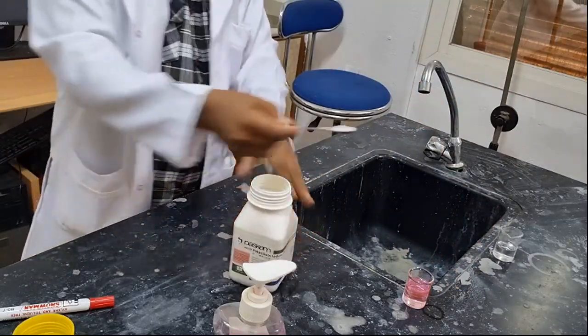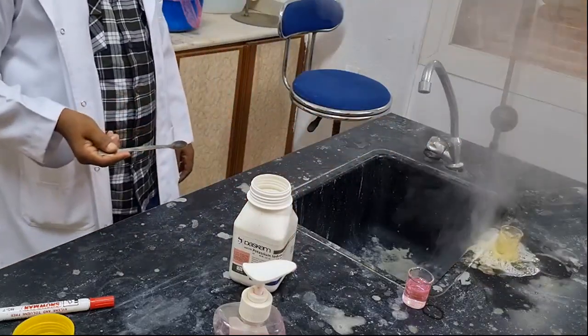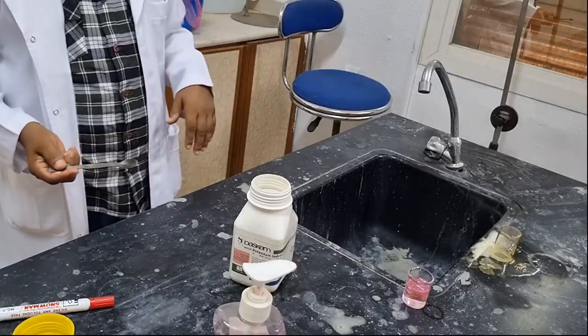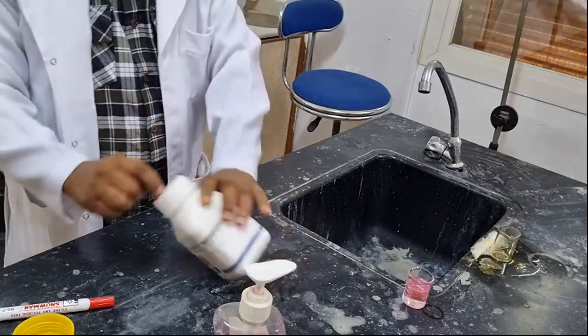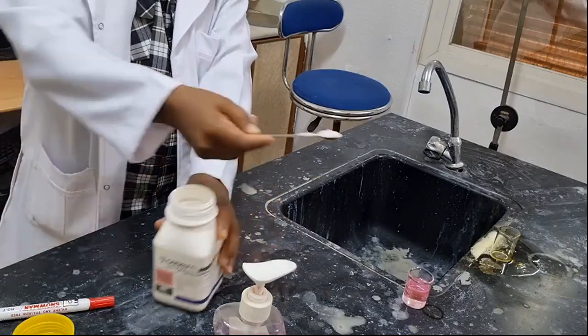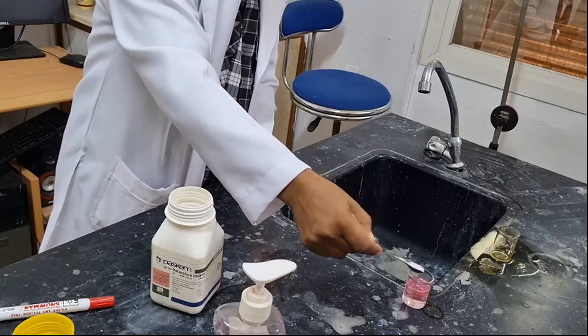Therefore, here look at it. What type of reaction will be taking place? You see fast decomposition. A gas evolved out. The gas produced with this decomposition process is oxygen gas, and the liquid content is water. Whereas here you see the reaction is not as fast, but look at what it looks like.